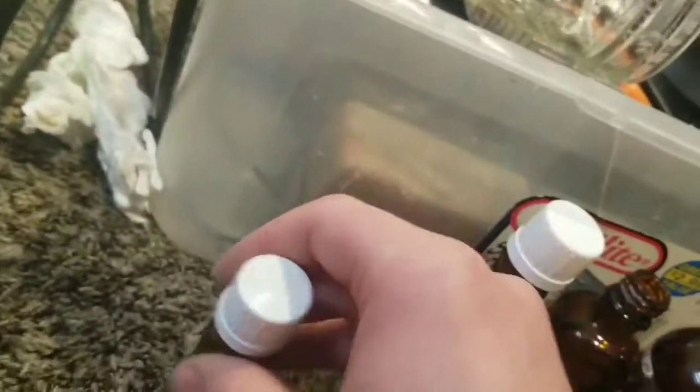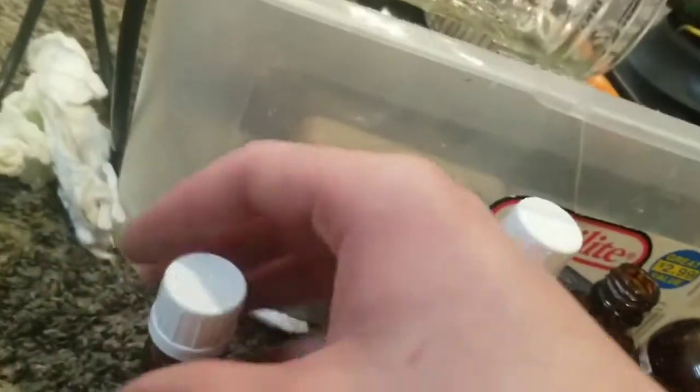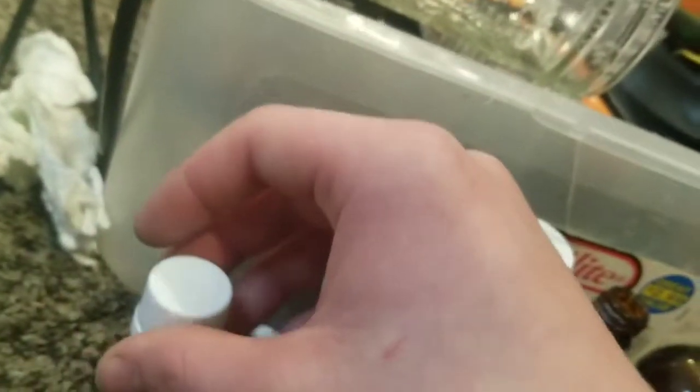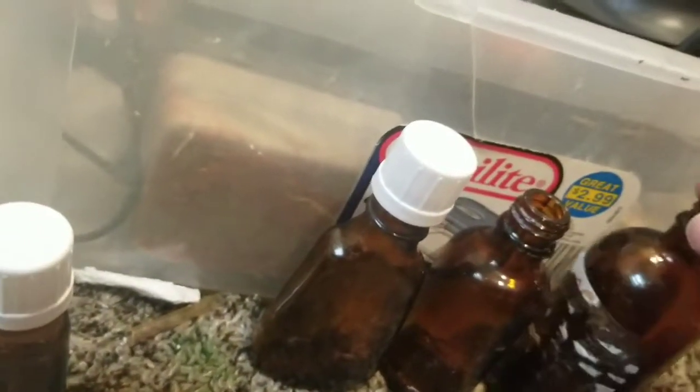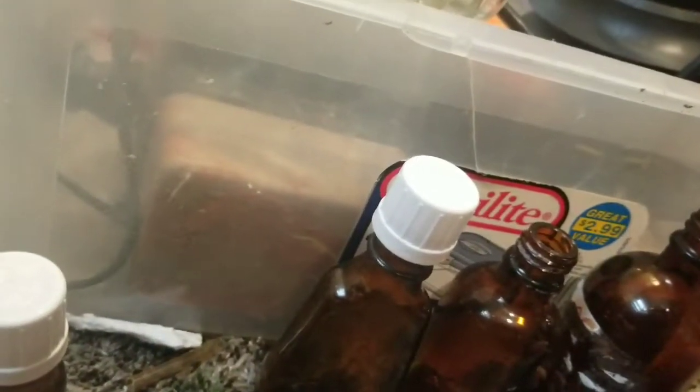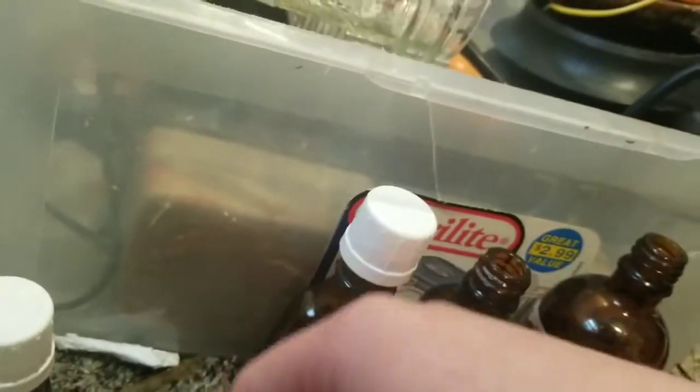But anyway, yeah, it bubbles it through water or hydrogen peroxide. If you bubble it through water, it will produce nitric acid, but it will produce it at a higher efficiency if you use hydrogen peroxide as a secondary oxidizer in the Birkeland-Eyde process. It's not necessary. You can just use plain old water, but it will increase the efficiency if you use peroxide. And 3% hydrogen peroxide used for cleaning wounds and stuff is pretty cheap where I live, so I'm going to use the peroxide instead of normal water. I really don't care that much.